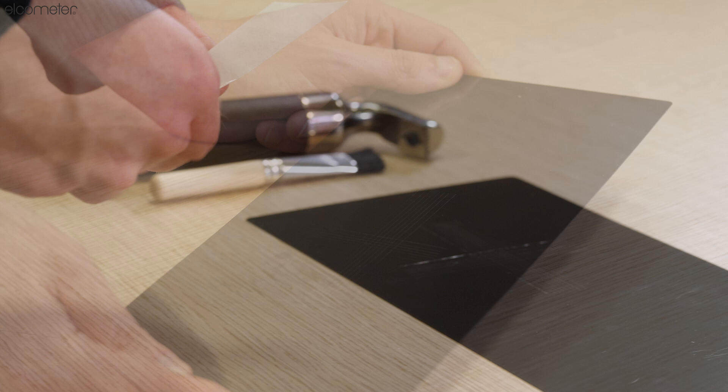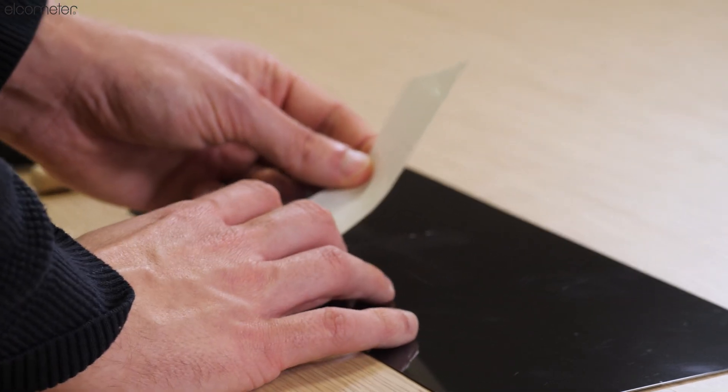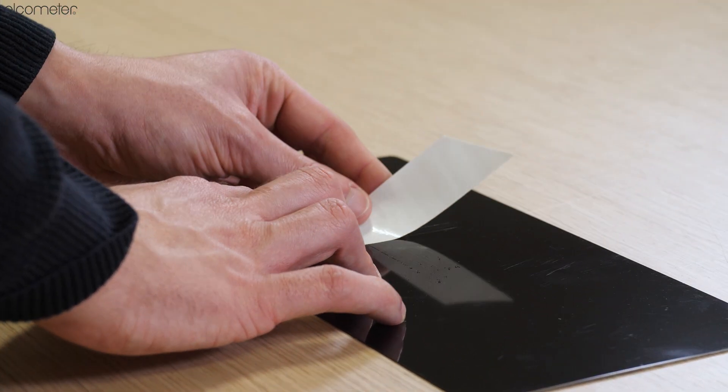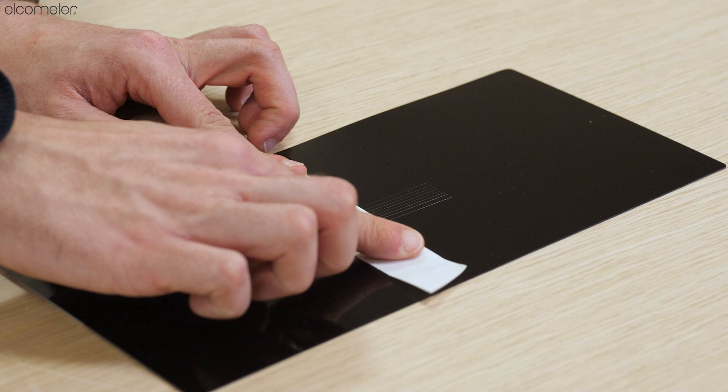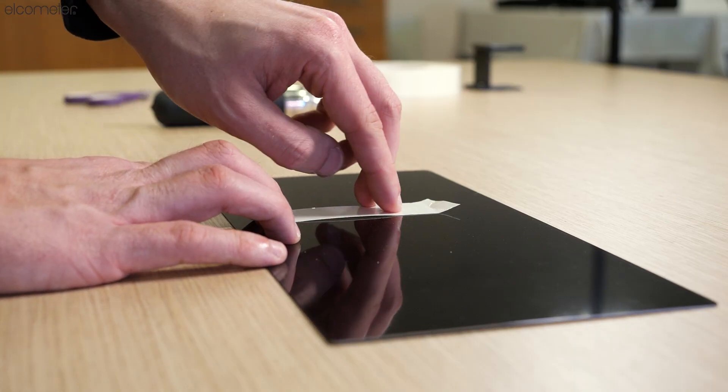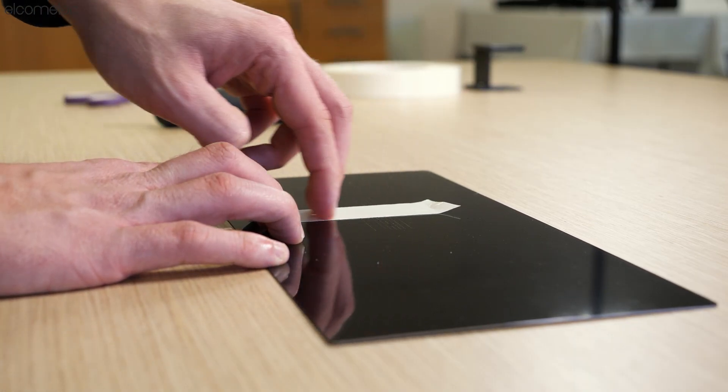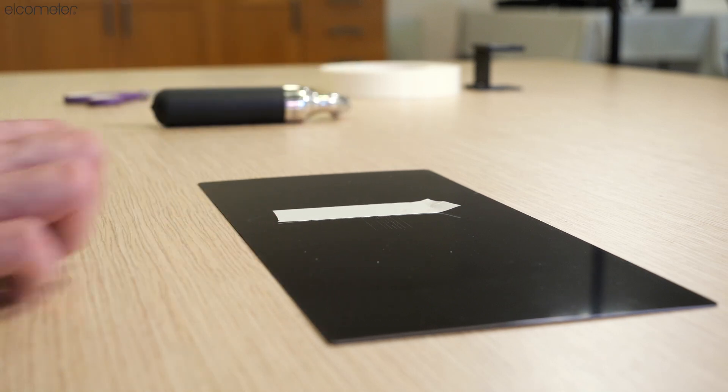If you are satisfied that they have done so, you should center a piece of tape approximately 75 millimeters in length over the cuts. To ensure that the tape remains in place, rub along the surface firmly.